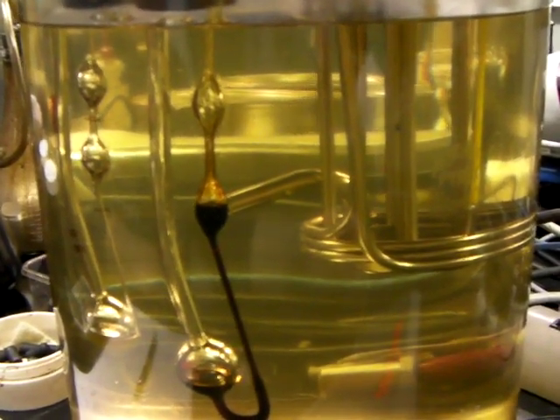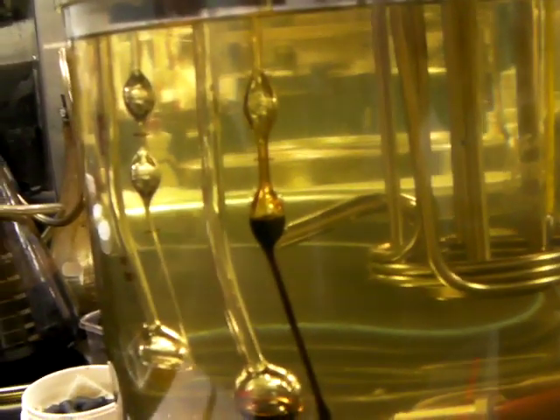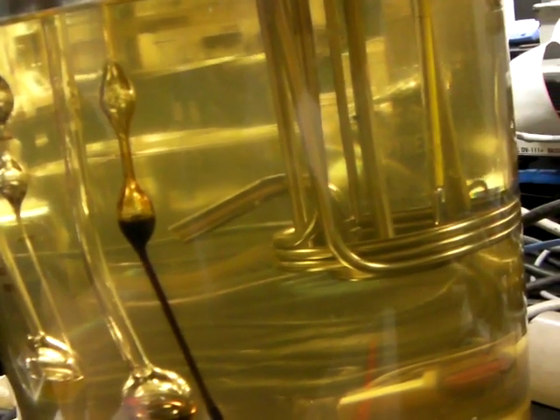This looks like a pretty thick oil that's going very slowly. And the larger the tubes, the faster the trials usually are. And you'd use the larger one for a higher viscosity oil? Yes. This one's pretty viscous.